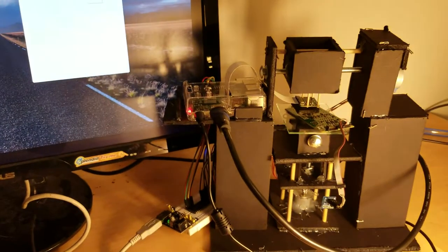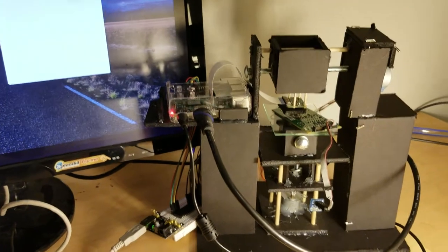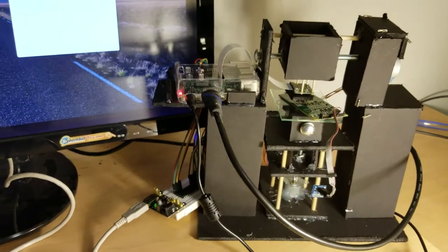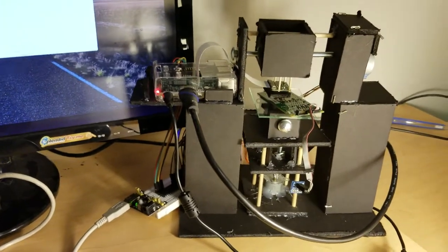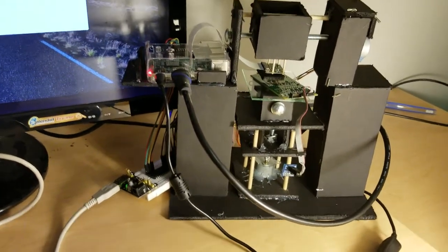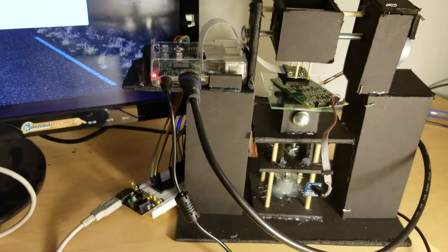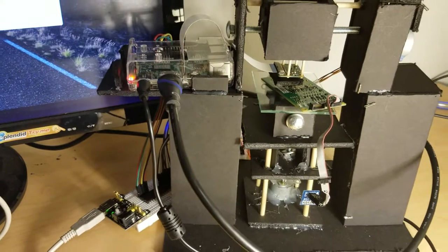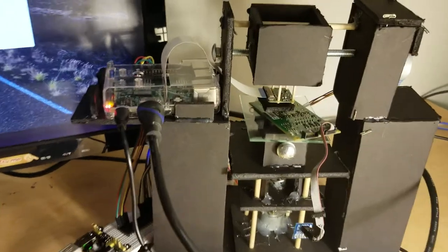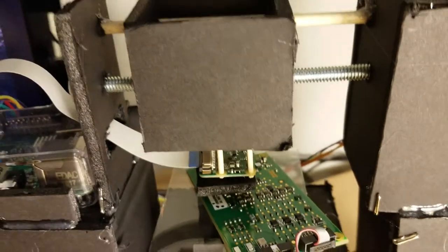One of the issues with this project was the actual framework. Starting off the project, I didn't really plan out how I was going to set this up. I always had this idea that, all right, I get a camera, I get three servos, I get a lens, and I'll get a microscope. Actually putting it together was rather difficult, but what I ended up doing was taking inspiration from a project I saw online and 3D printers, and I set up the camera, which is sitting here on rails.